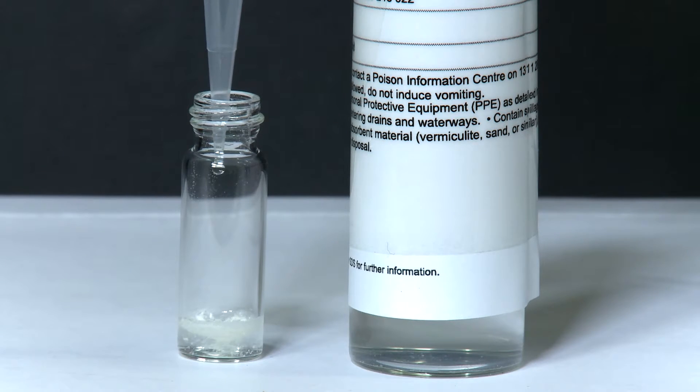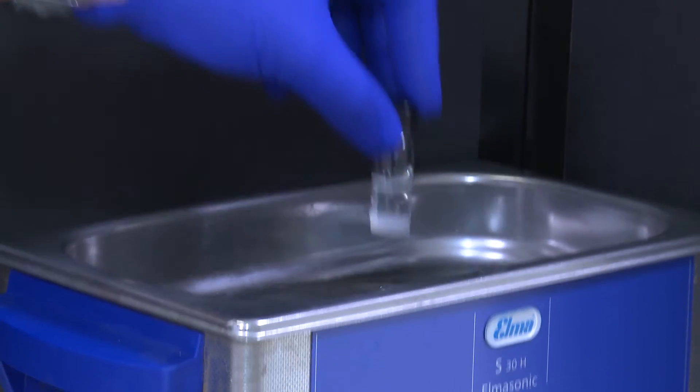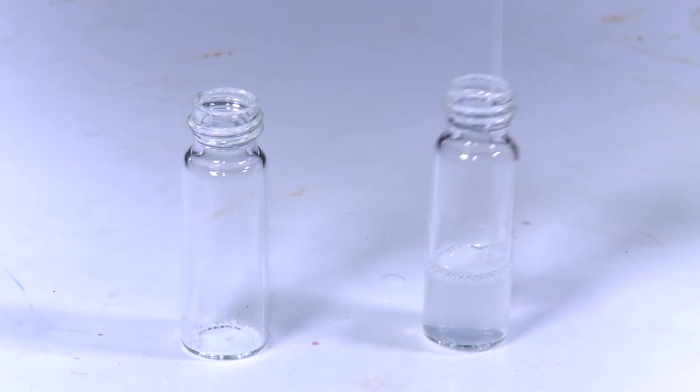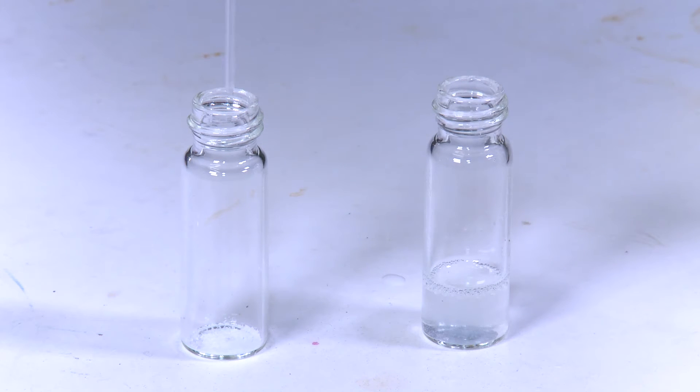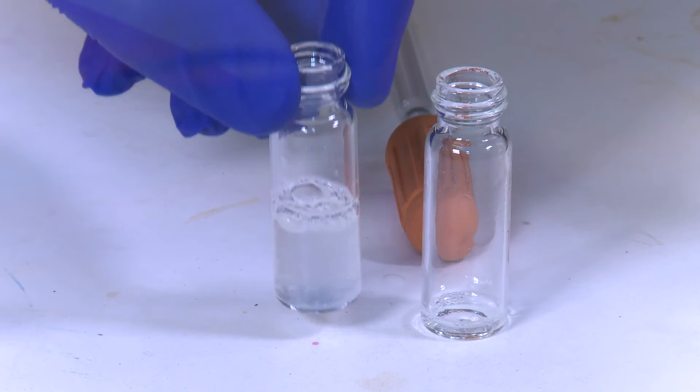Here we add some dilute sodium hydroxide and sonicate to dissolve our gel. We add this solution to two molar equivalents of a pH switching compound which slowly lowers the solution pH. We give this a stir and then let it gel.